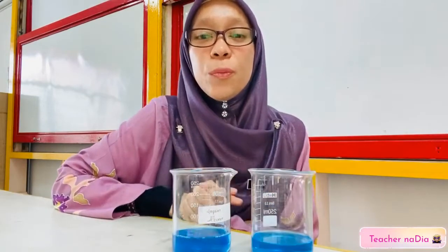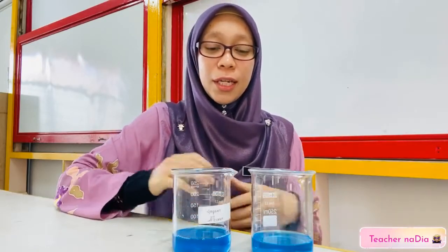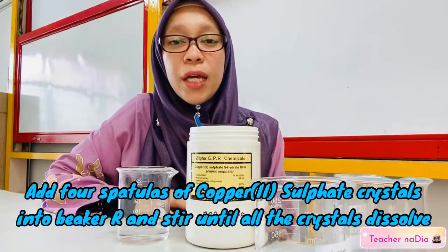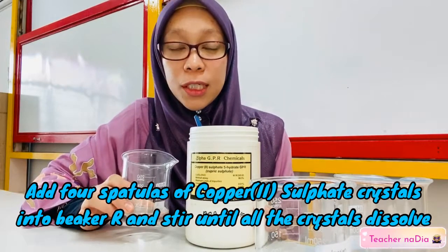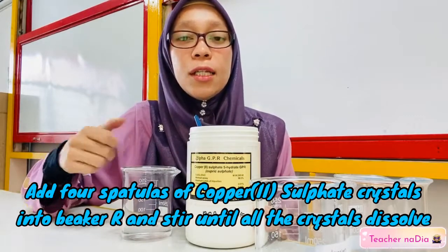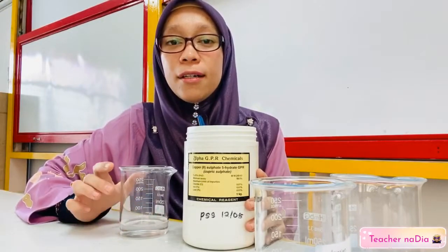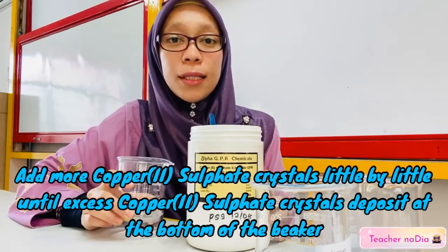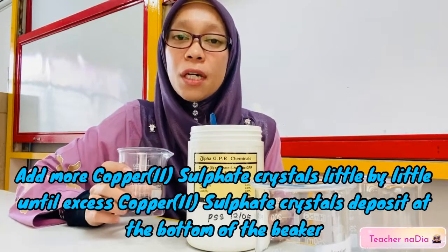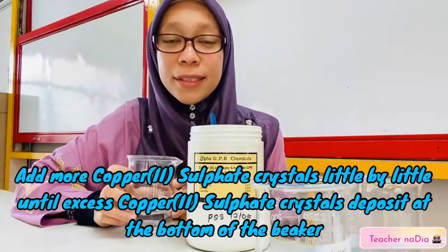Now we're going to prepare the third solution, which is R. For beaker R, we are going to add 4 spatulas of copper sulfate crystal in the distilled water, and we're going to stir it until all the copper sulfate crystal has been dissolved. And then we're going to add copper sulfate crystal little by little into the distilled water until excess copper sulfate crystal is deposited at the bottom of the beaker. Let's try.